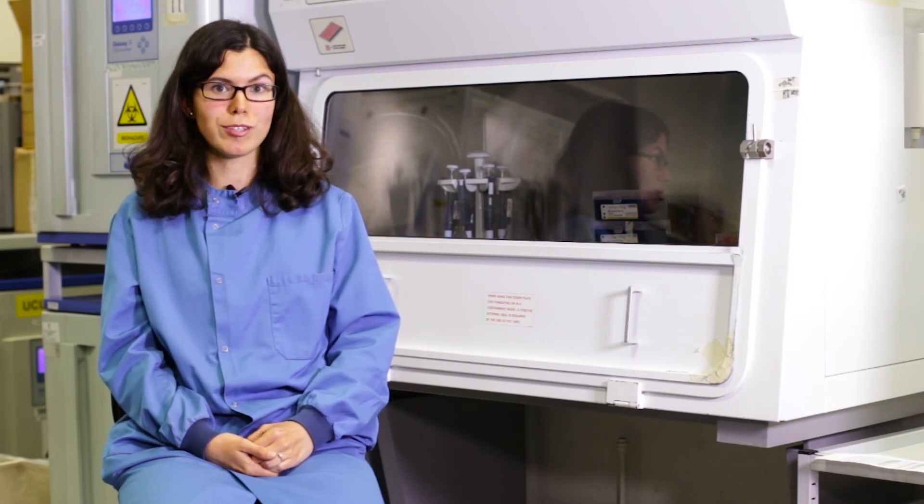Today I have demonstrated how to do TC culture and how to perform an MTS assay. I hope you will find it useful for your studies.